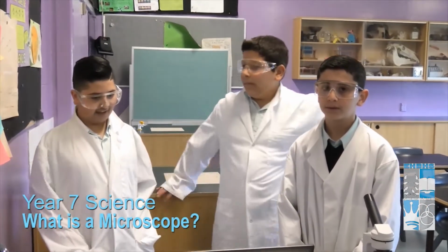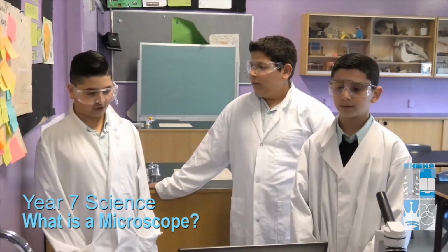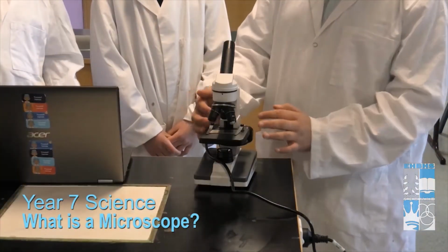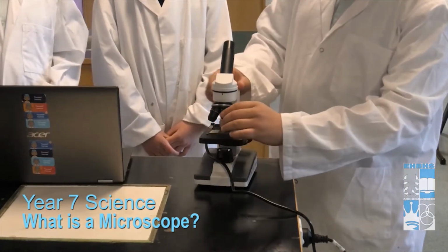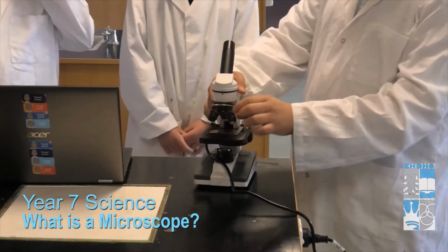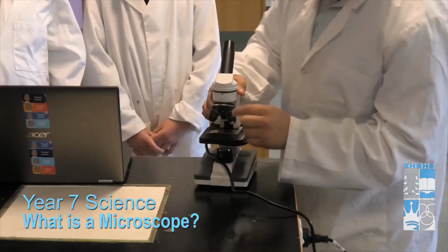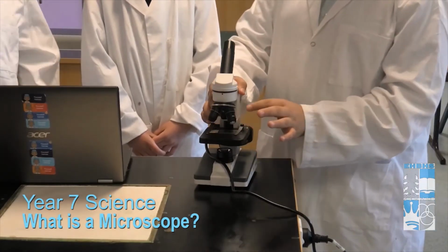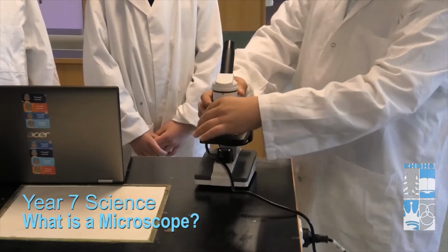Let's start by discussing how to use this microscope and the uses of a microscope. What is a microscope? Please show us what it is. In a microscope, there are two most important parts: the eye lens, to zoom into the thing we are examining, and the objective lenses, which are the lenses we zoom in with. There are three objective lenses: one 4 times, one 40 times, and one 10 times. But we have to multiply them by 10, so it will be 40, 400, and 100.